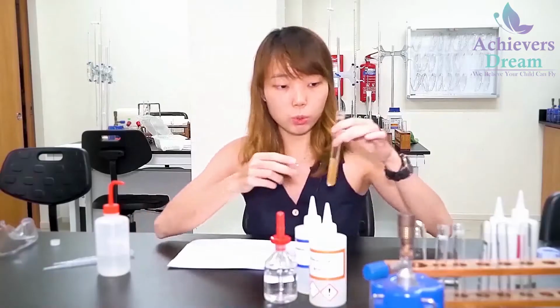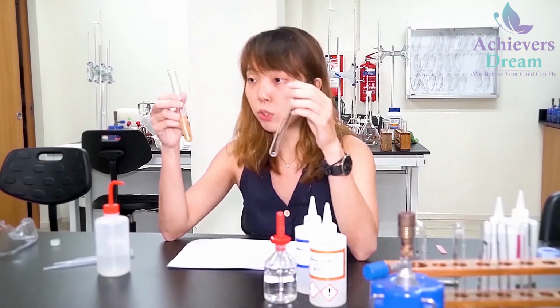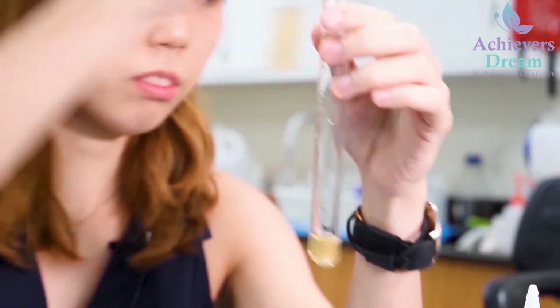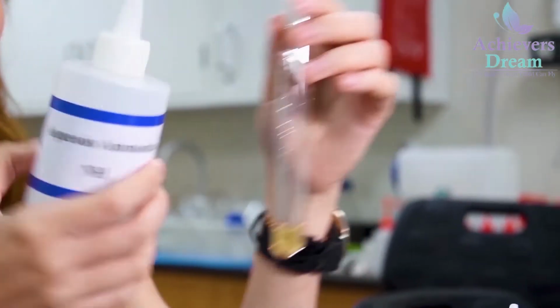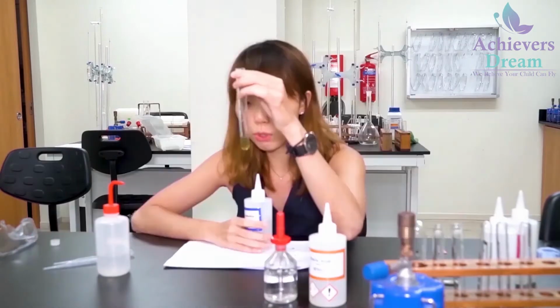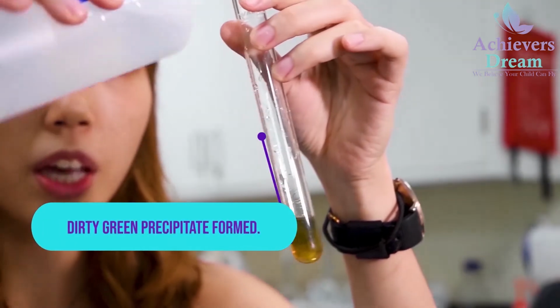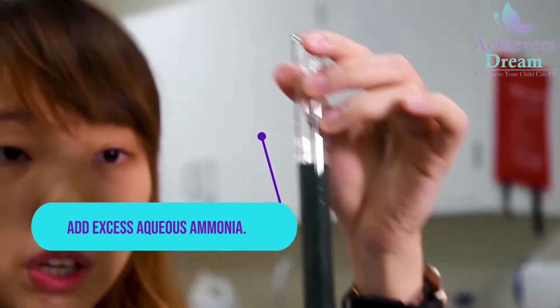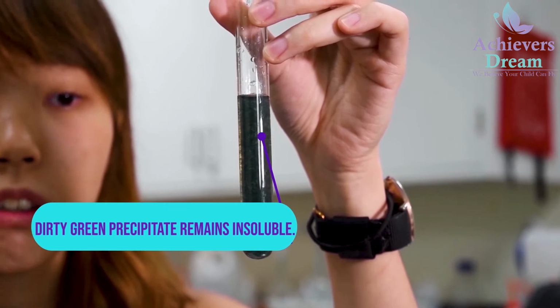Now for the first step, to 1 cm depth of X in a test tube, I'm going to add in aqueous ammonia. So first I'm going to add in a few drops. Upon addition of a few drops, you notice that there is formation of a dirty green precipitate, and now I'm going to add in excess. Even in excess aqueous ammonia, your dirty green precipitate still remains insoluble.